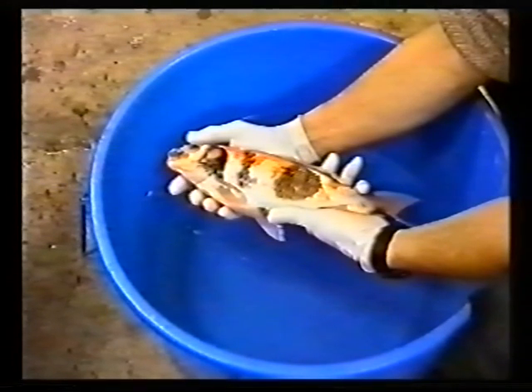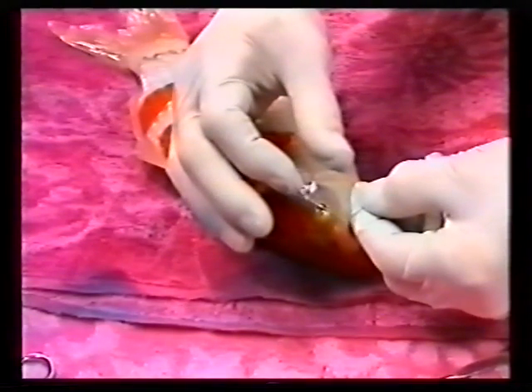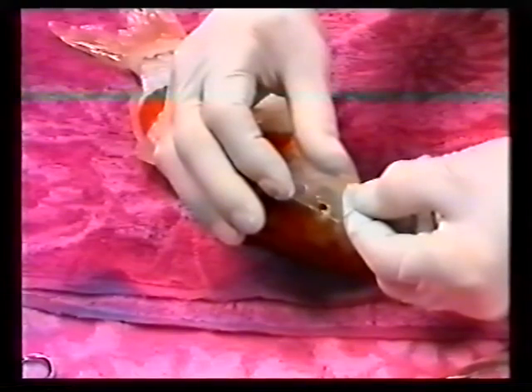This procedure is as much for your safety as the fish, as some fish diseases can be passed on to humans. After taking the scrape, bring the mucus to the center of the slide, place the cover slip over the specimen, and in a hinge movement, lower gently to ensure no air bubbles remain.